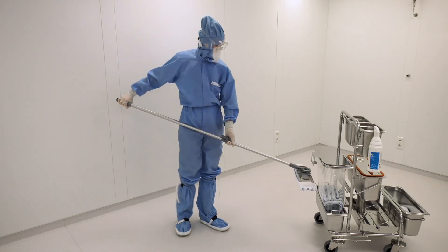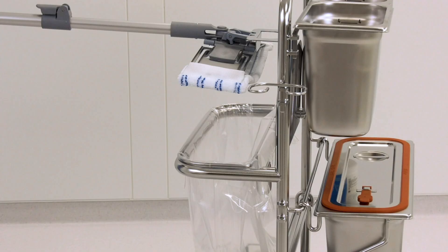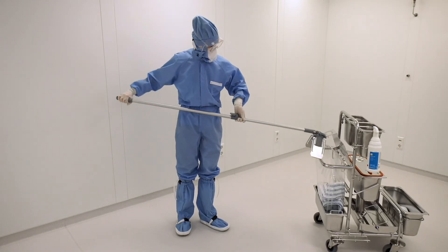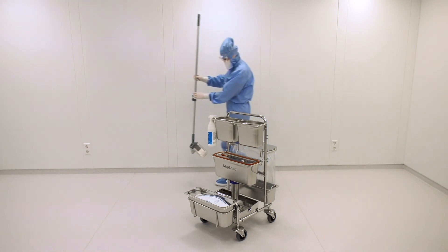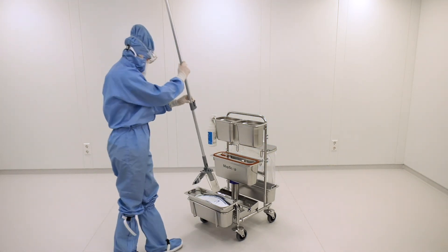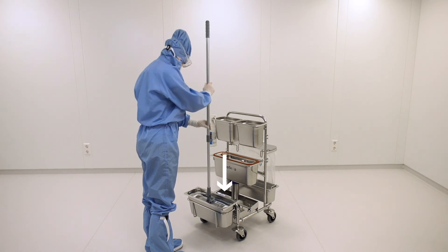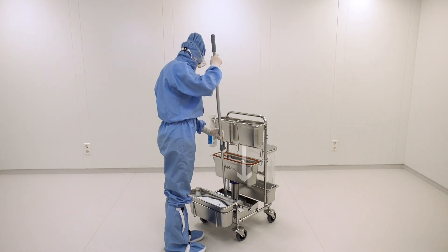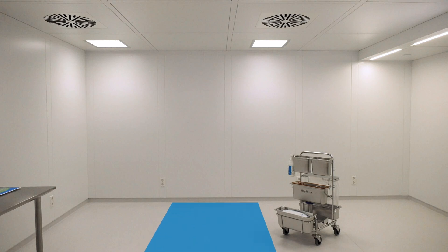Once you have completely wetted the first area, you can drop your used wiping textile on your cleaning trolley without touching it. A clue to changing your mop textile is the liquid discharge. If the mop runs sluggishly and or shows a broken film of liquid on the floor, it is time to change it at the latest. Pick up a new mop cover as planned and soak it with a predefined amount of liquid, and you can start wiping and disinfecting the next floor area.